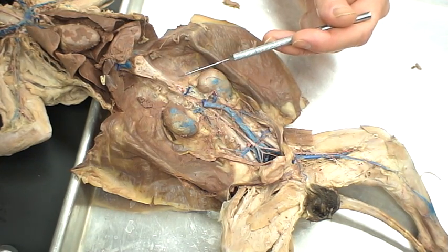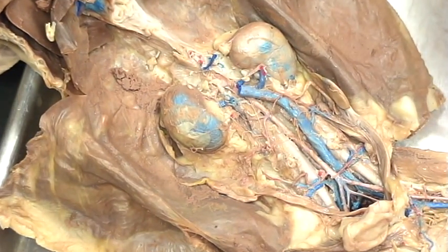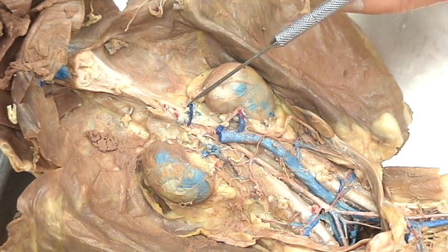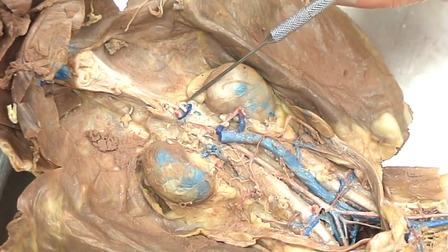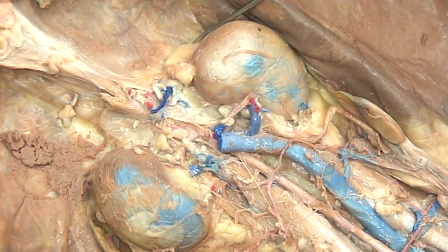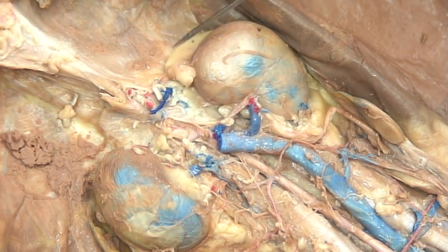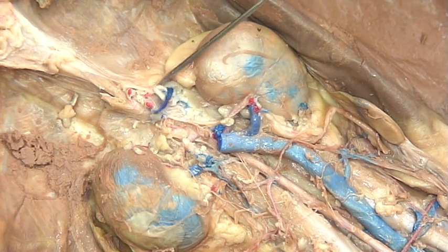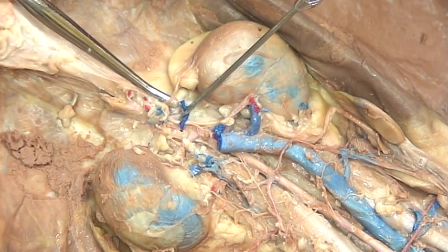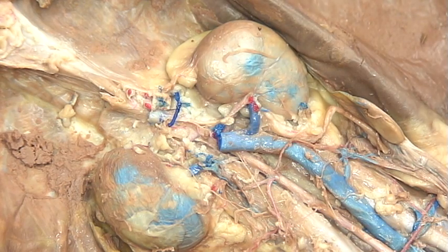We're going to pick up the story where we can start to see some of the organs in place. One of the first set of arteries we'll see runs underneath — the vein is on top in this case — and it runs to the top part of the gland that sits right on top of the kidney. This gland is called the suprarenal gland, or the adrenal gland. The artery that feeds this, sitting right here in the mesentery, is called the adrenal lumbar artery.